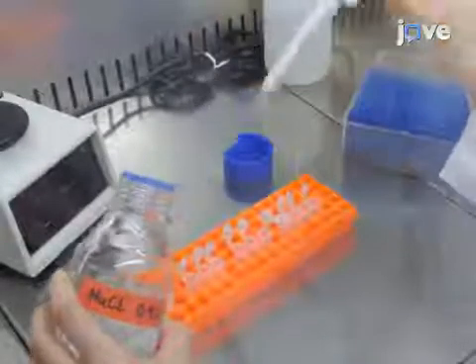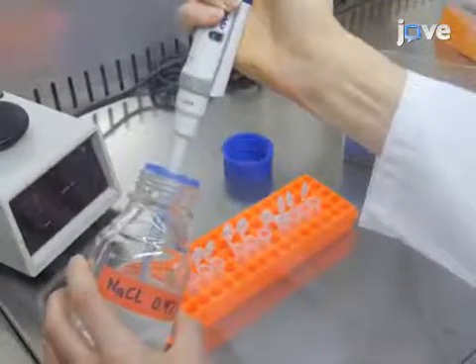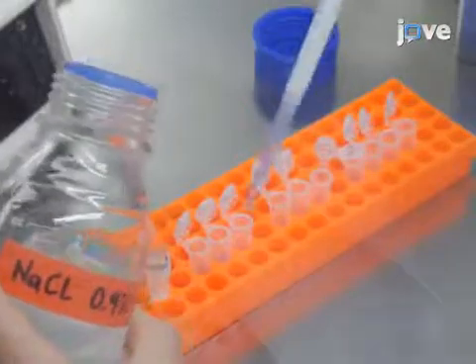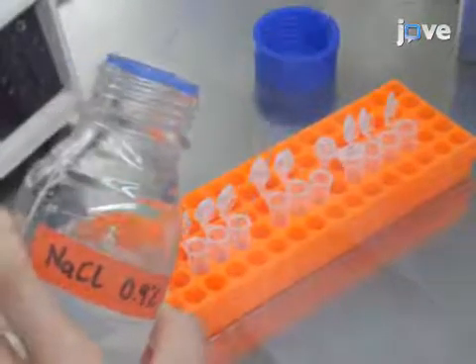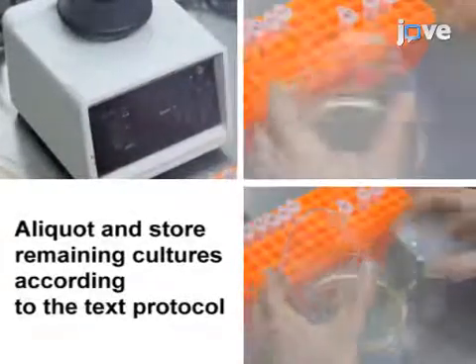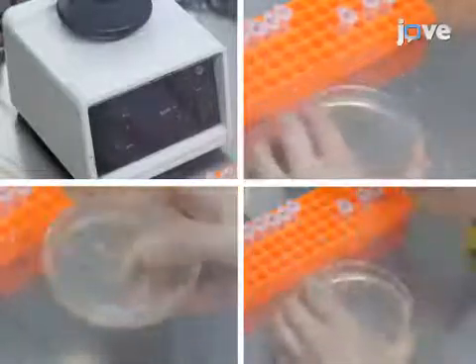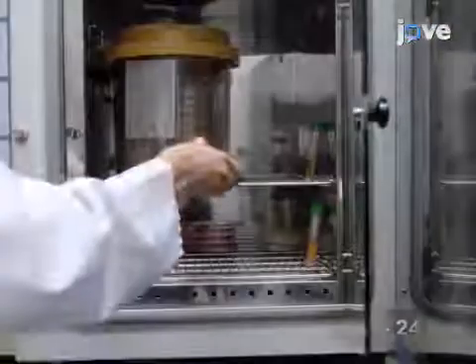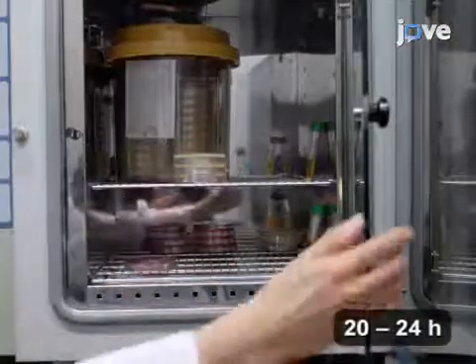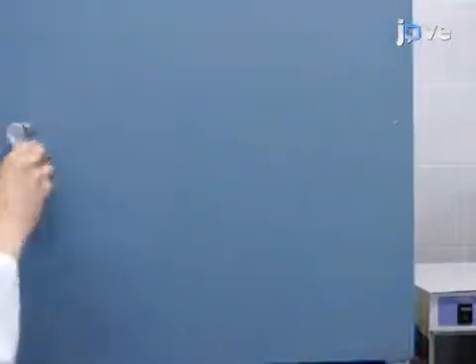After growing bacterial cultures according to the TEXT protocol, count the cells by first using ice-cold 0.9% sodium chloride solution to make 10-fold serial dilutions. Spread 100 microliters of each dilution onto a BHI agar plate. Incubate the plates at 30 degrees Celsius overnight for cell growth and colony formation to determine the CFU per milliliter.